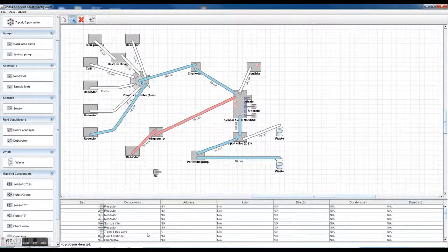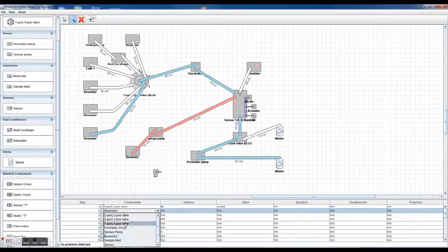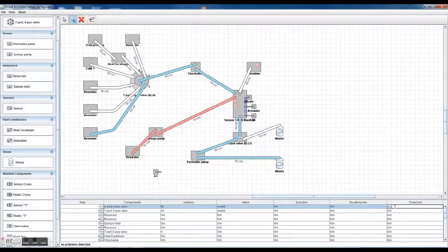And then basically, as your fluidic circuit is all designed, you can come in down here and say, okay, well, I want to first turn this valve here at B1, and at time equals 0, I want to switch it to B1, okay? And then I want to take the 7-port 6-position valve, and I want to switch it to maybe my wash fluid 5, A5, and I want to switch it at time equals 0. So basically that would be done initially upon initialization of the system.